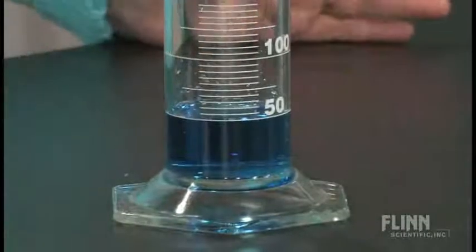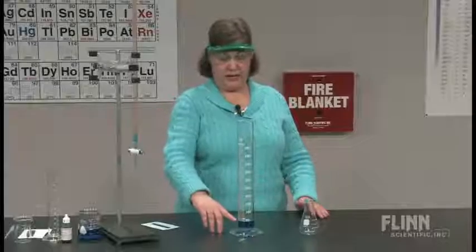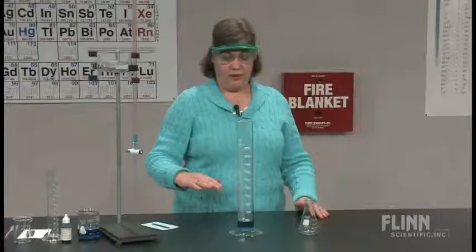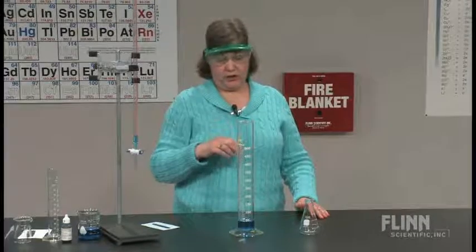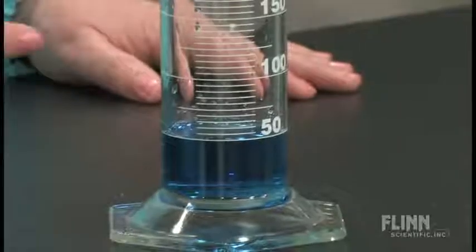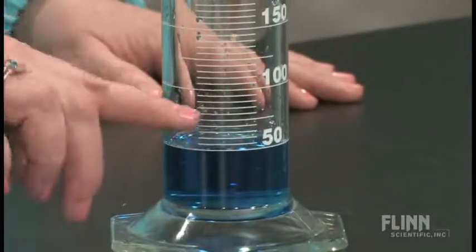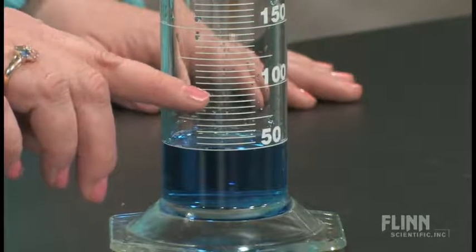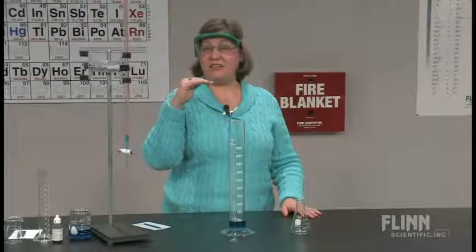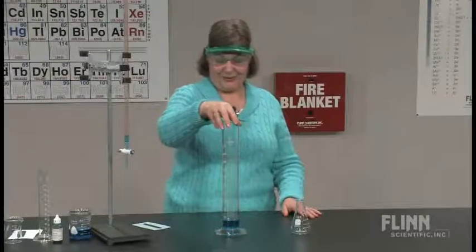Now we've got a 500 milliliter graduated cylinder, so as long as we're focusing on that, let's look at what the major markings are. We can see obviously 50, 100, 150, 200, 250, so on. And then there are minor markings in between those, and it looks like there are two sets of lines, so there's a line here which would be, let's say, 125. So that means I can read 105, 110, 115, 120, 125. Is that right? Does that look right? Okay, so each minor marking is 5 milliliters. So if you've got a good shot there of the level, then I'm going to go turn it around so that I can read what it is.